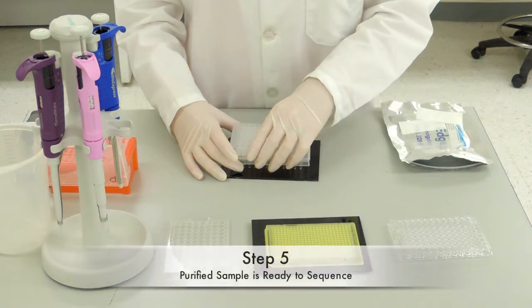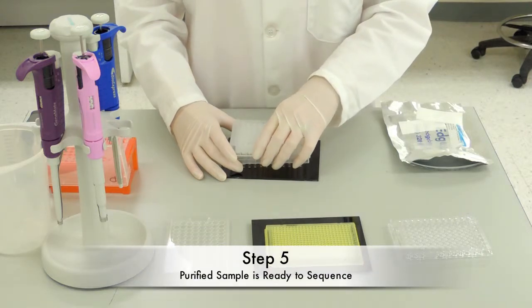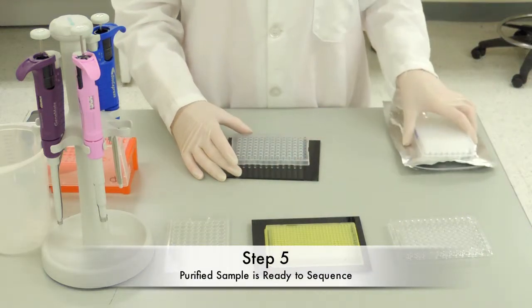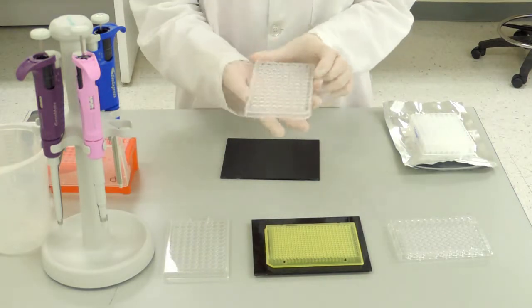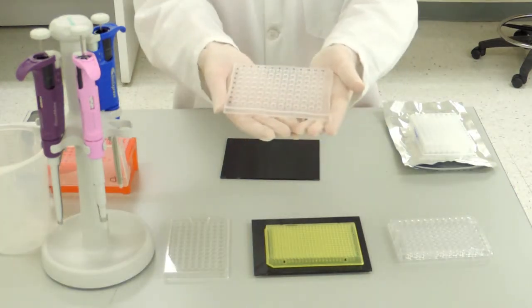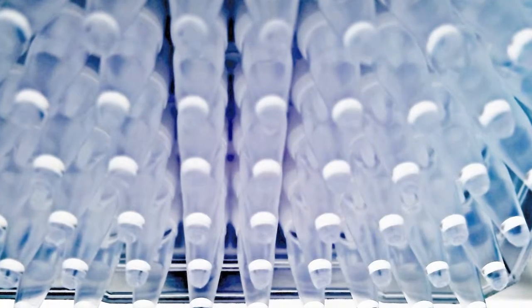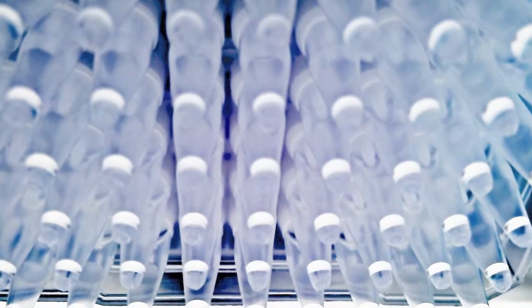After the second spin, the Performa plate can be discarded. You have now attained a purified sample that is ready to be sequenced. As you can see, Performa provides an even eluate recovery.